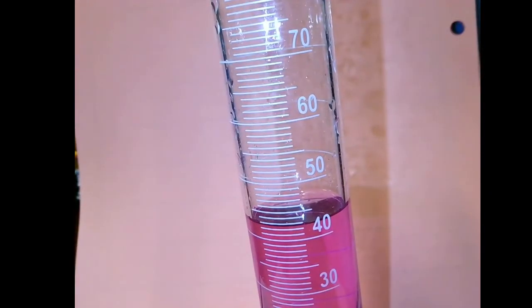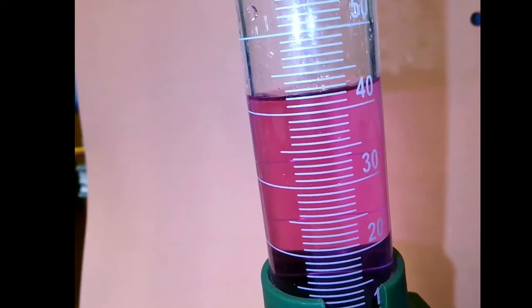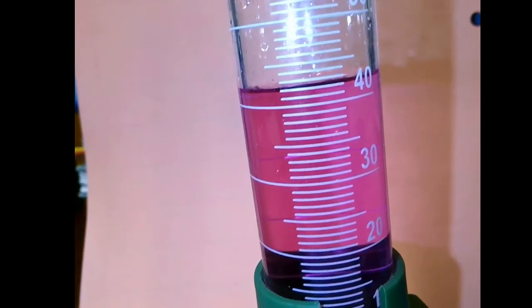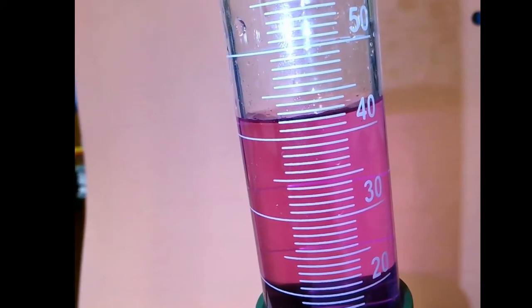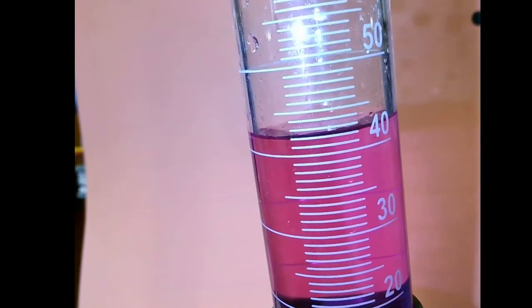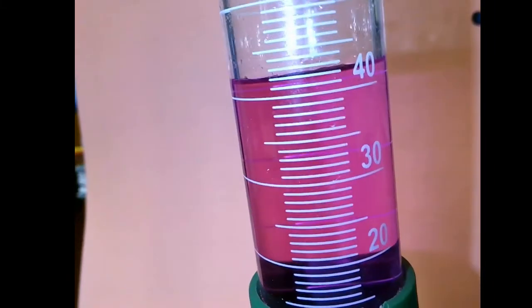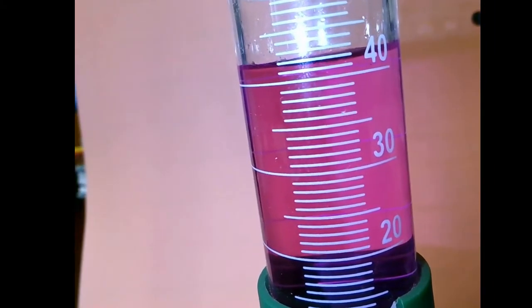I just want to pound out the bubbles that may have formed in there. This graduated cylinder is one that we have in lab, and it also goes up to 100 milliliters. Same thing when you're using this graduated cylinder, you do want to get right at eye level and see where that falls in terms of measuring. With this graduated cylinder, we are able to see that it is someplace between 40 and 50. But now each line is recorded in there, and there is a 41, a 42, and I'm just going to lift this up a little bit more.